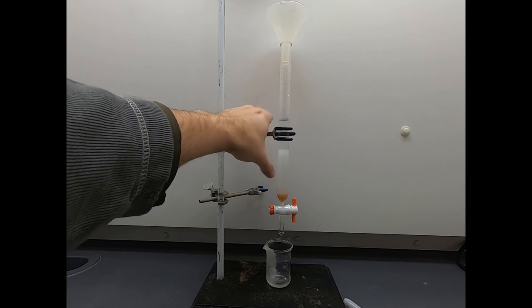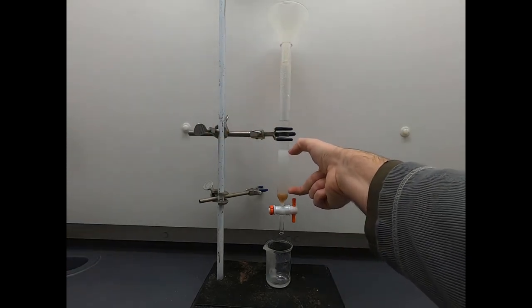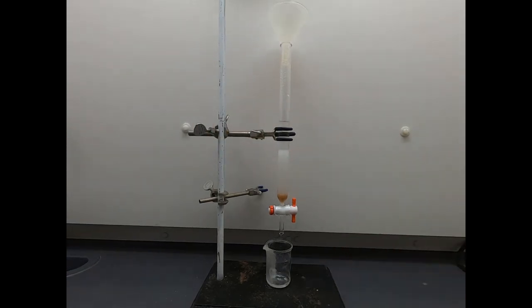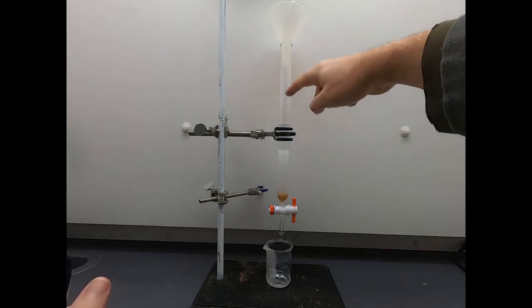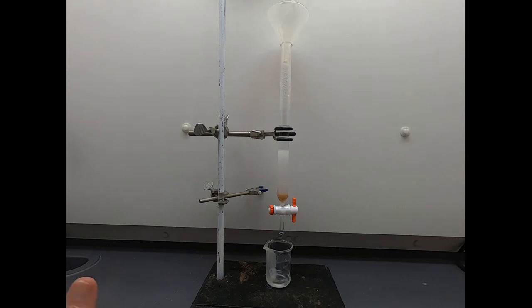So what we've done is we have gotten a bed of silica gel in here, and this is the stationary phase through which we are going to pass our molecule and the mobile phase, or our mixture and the mobile phase. So let's just wait a little bit. Let this drip down. I'm going to clean up. There's a little bit of silica gel up here. I'm going to rinse that down, and then we'll be ready to prepare our column to load our mixture on the column.